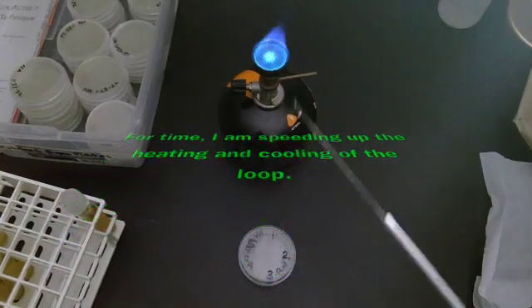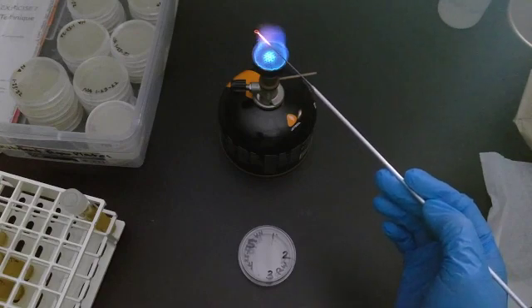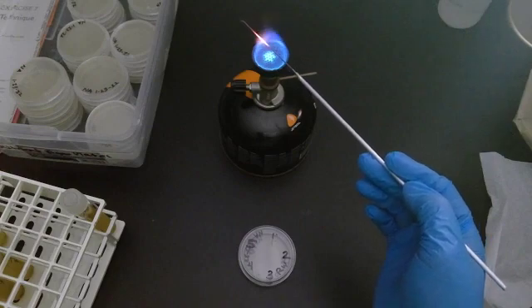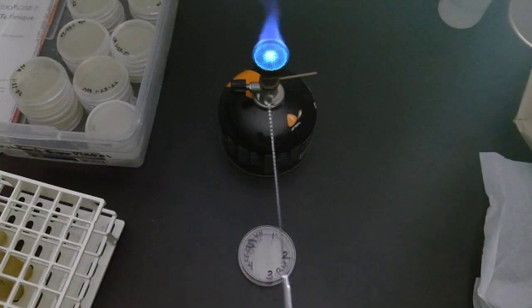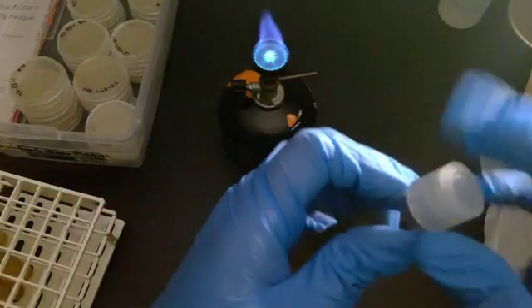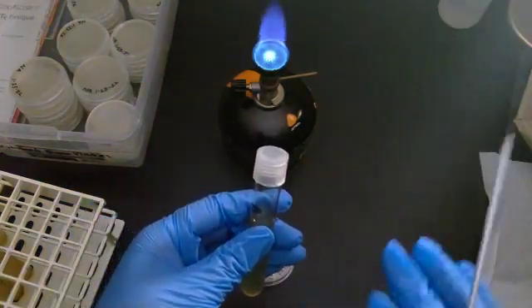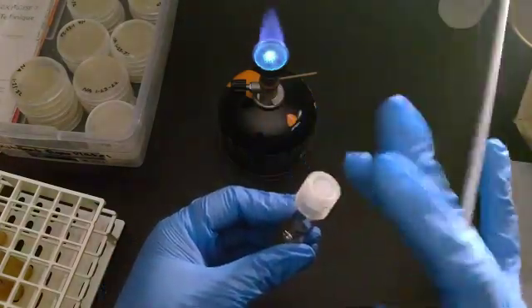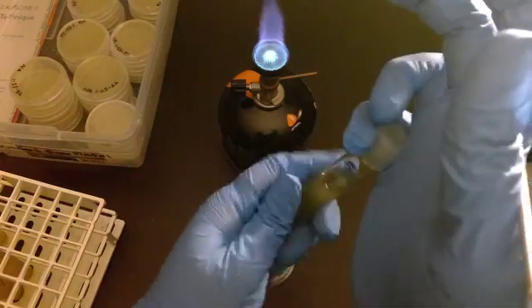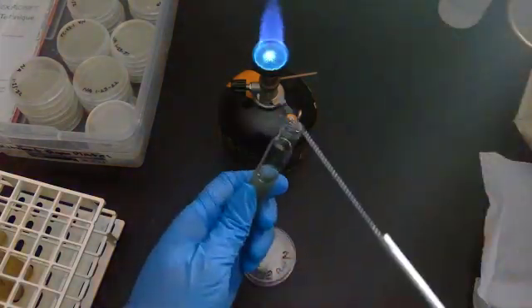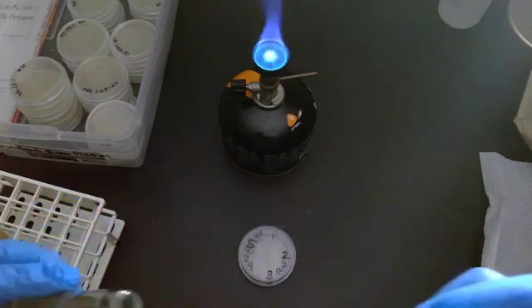Here's my inoculation loop, there's the flame. This is liquid media with a whole bunch of bacteria all mixed in, so I want to make sure that I separate all of those bacteria from each other. I've got my sterilized inoculating loop that I just put through the flame. I've got my sample of mixed bacteria. In the first video when Mr. Secord talks about getting bacteria to put onto a slide, he talks about the fact that this lid, if it's a liquid culture, can't touch the lab bench. So hold it with your pinky, unscrew the lid. He also mentions the contamination that can be at the top here, so we put it through the fire. We take our loop, we put it in our sample.